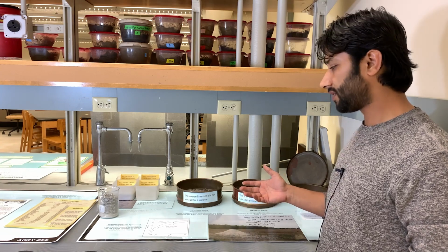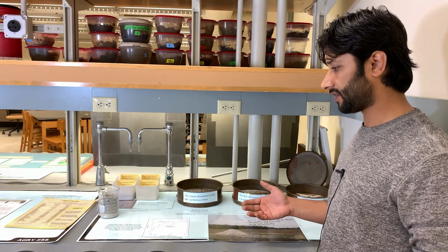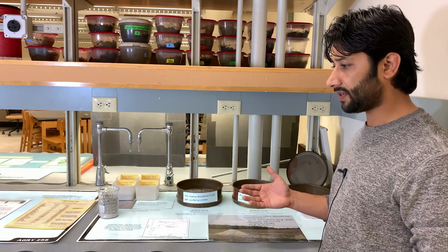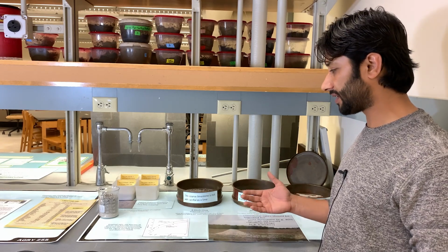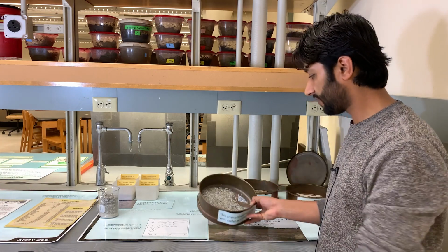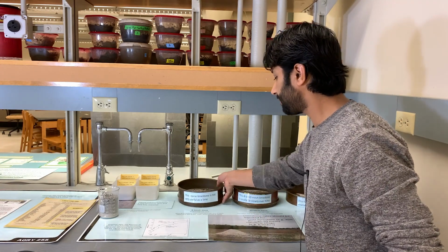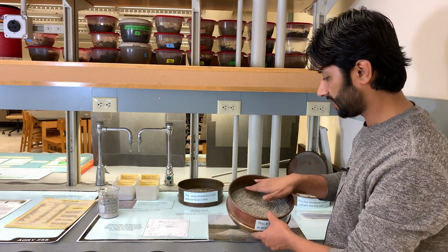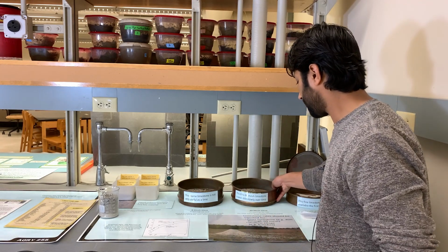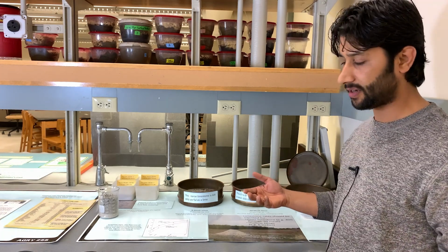In this station, we would like to talk about the quality of lime and its satisfactory level in Indiana state. In order for a lime to be considered satisfactory in terms of quality, 80% needs to pass through the 8 mesh. This is the 8 mesh sieve, so it has 8 openings per inch. And then 25% needs to pass through the 60 mesh, which has 60 openings per inch. That will be how we determine the quality of lime.